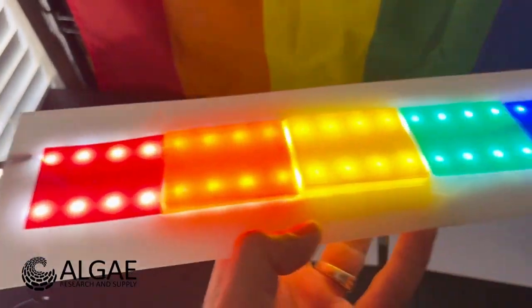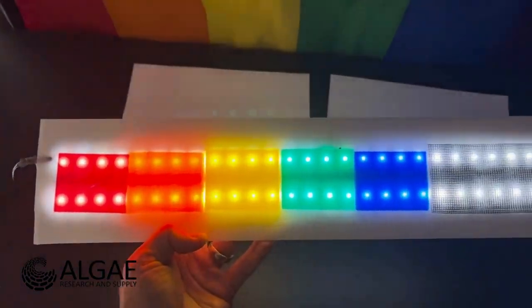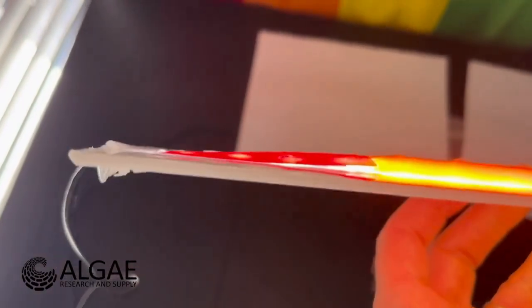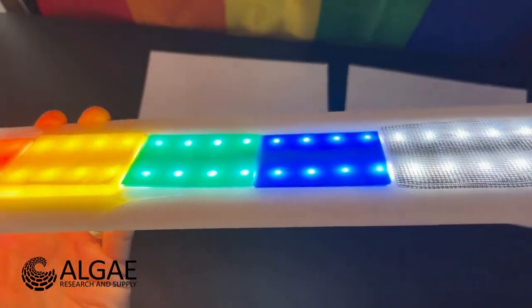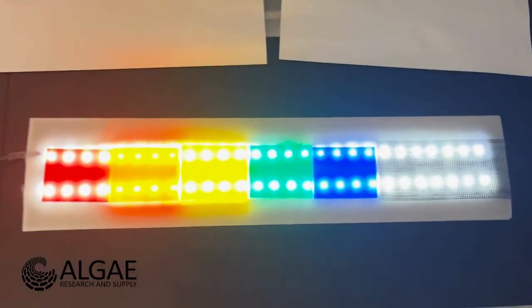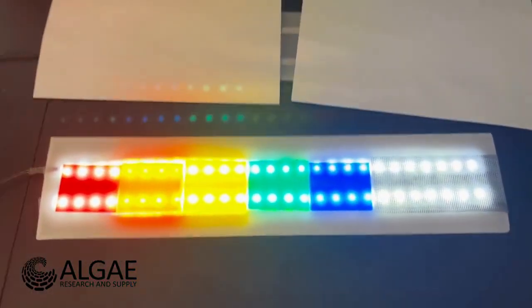And so I have gone ahead and used some packing tape to attach all of the light filters onto our benchtop light. We've got a number of different layers here depending upon which filter we used. The red only has a single one. Orange, yellow, the green, and the blue, and the screen all have different numbers. So I just laid them all out on there and we normalized them using the meter. And then I put a big piece of tape over all of them so they won't fall off as we do our stuff here. And now we will get going.